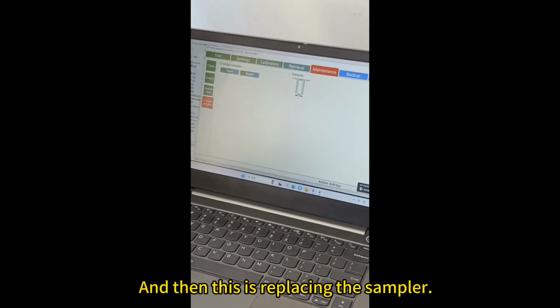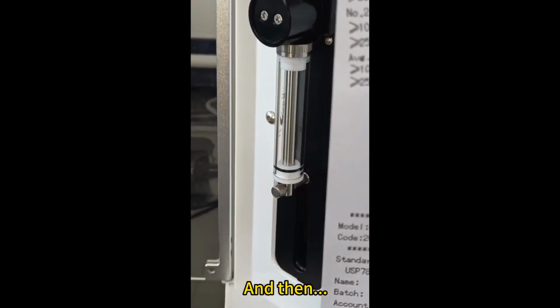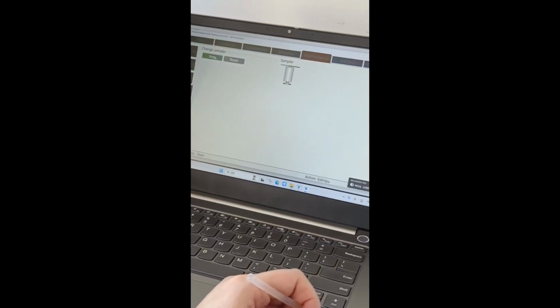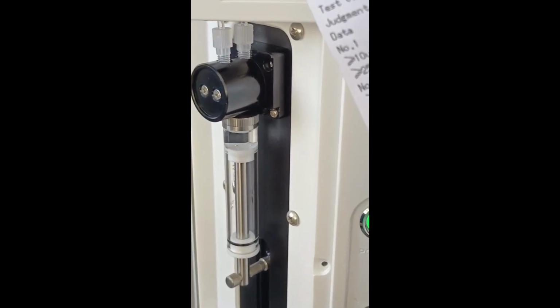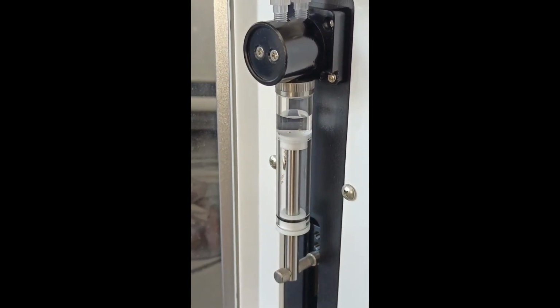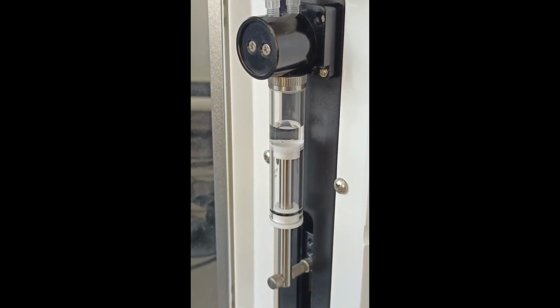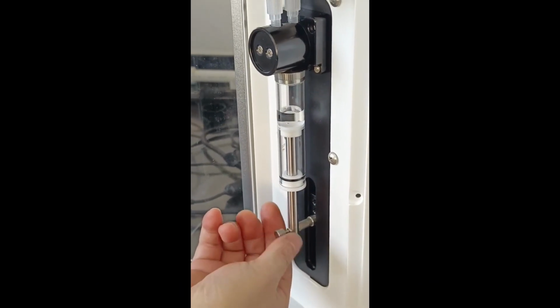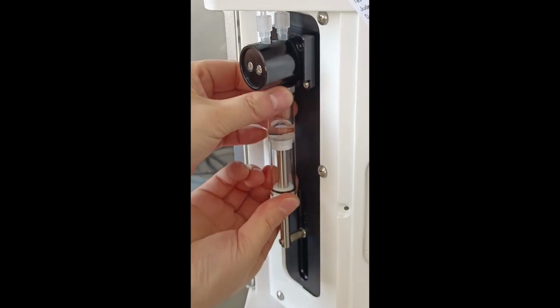And then this is replacing the sampler. Yeah, look at that. I'll operate it for you. And then you click this to start. The sampler is in a certain position, a certain line position. After this, you see, we unscrew this to the left. What about after unscrewing it? Both hands. Screw like this.